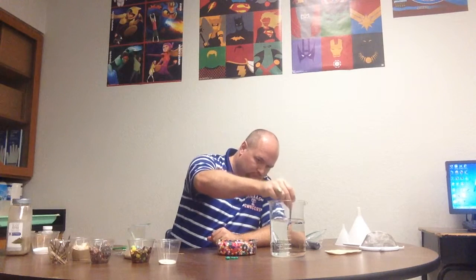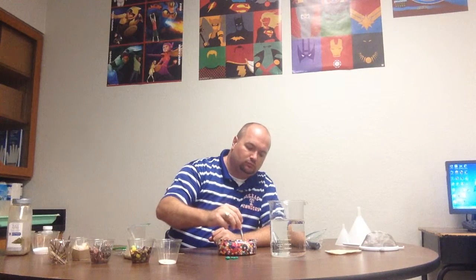I have these tweezers. Now, this would be very tedious, but if I was just going to start separating, let's say I wanted to separate all the green out, what physical property of these beads allows me to use these forceps? Not sure? I'll give you a hint. Got it yet? It's that they're a solid. I can only grab these with the forceps because the beads are a solid.